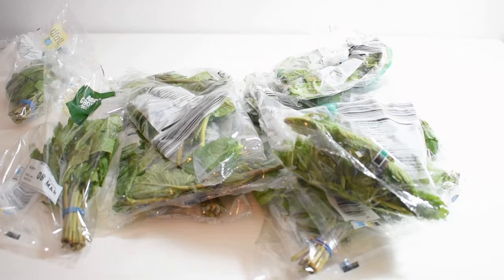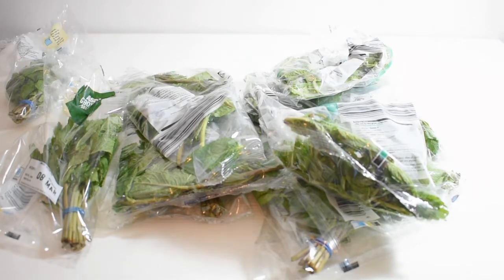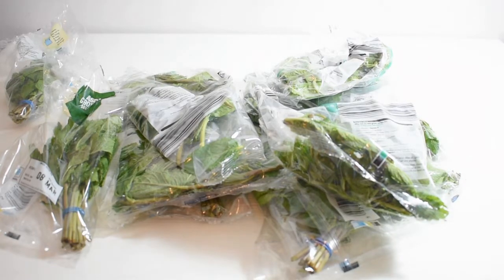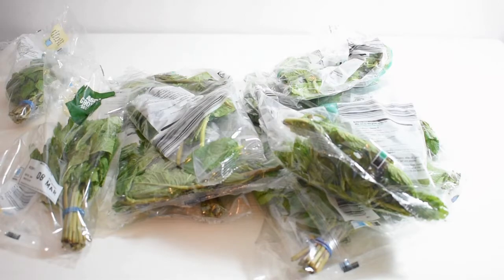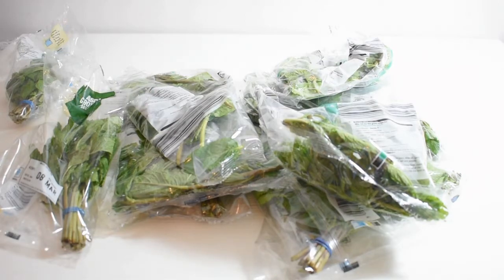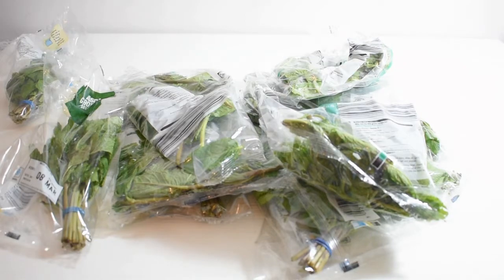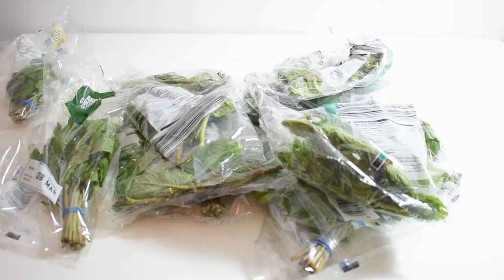I'm starting with 330 grams of mint from different shops in different packets with varying proportions of leaves and stems. I'm going to separate the leaves first because those hold the most mint oil, which has the menthol.